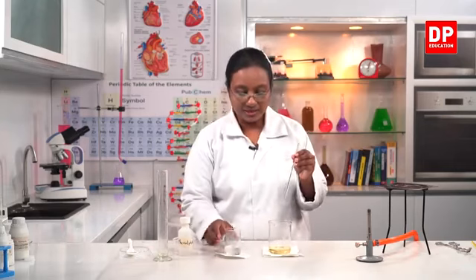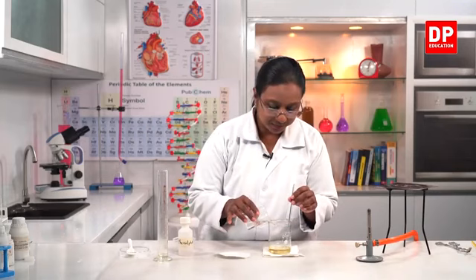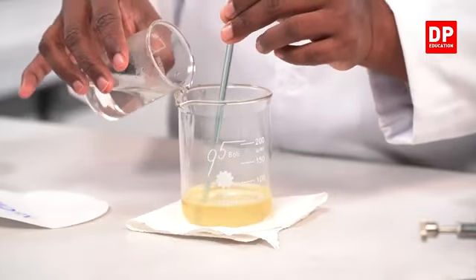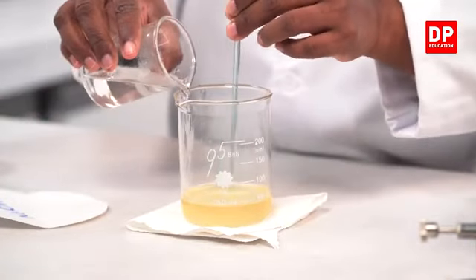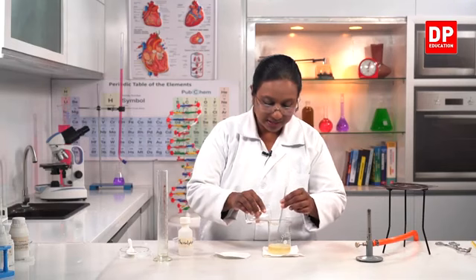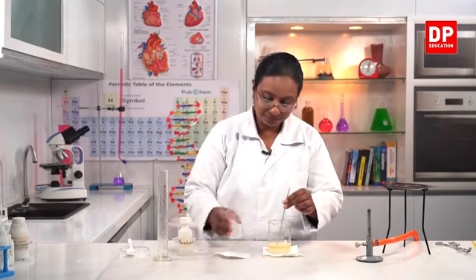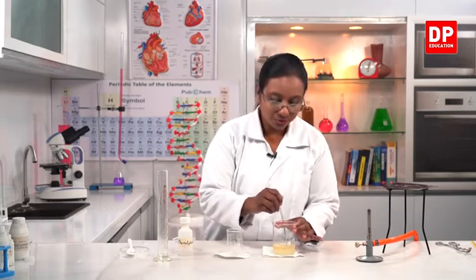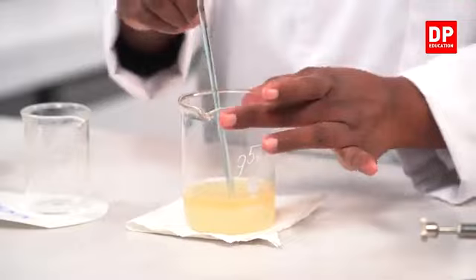Now, little by little, I have to add the sodium hydroxide solution and mix it well, so that the reaction will take place. And this mixing has to be done continuously for about 15 to 20 minutes. And when we mix, you can see the change, the pasty-like nature of soap appearing. So now, because it was not brought to boiling point, I can touch the beaker. There's no problem. It's still warm, but still I can touch the beaker.